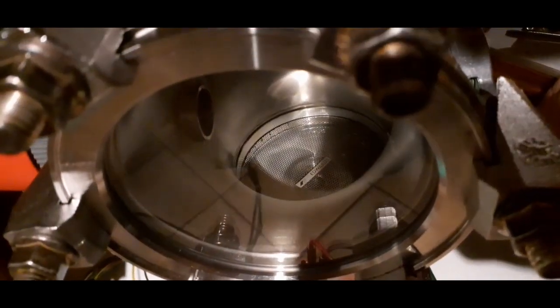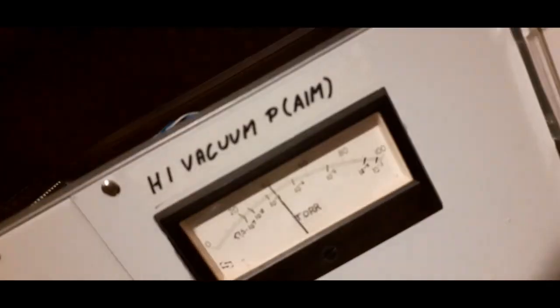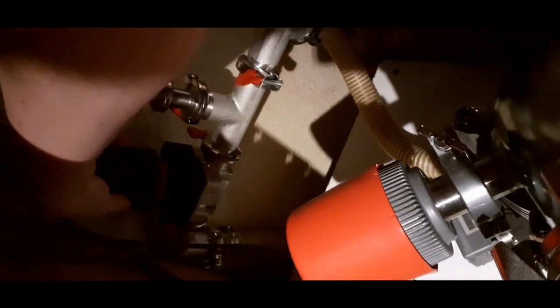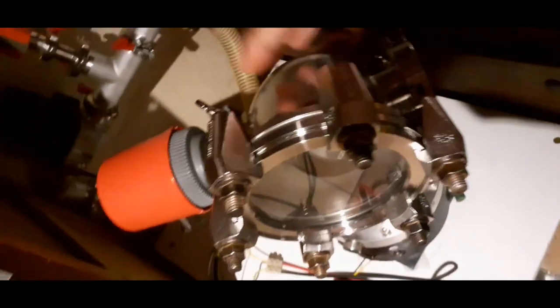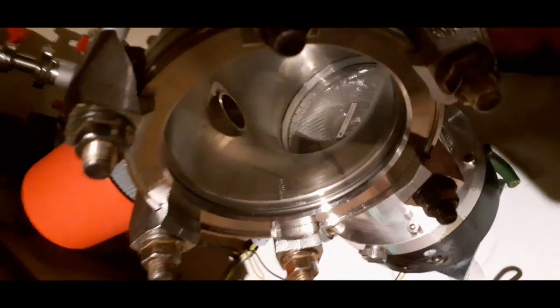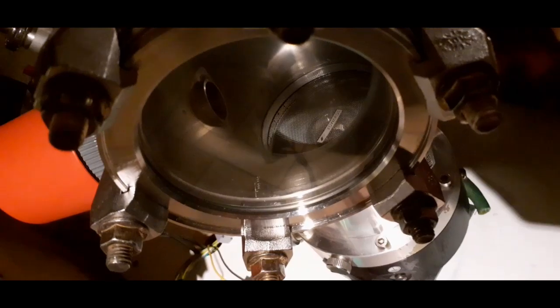Alright, let's go through the turning off procedure. I don't think we'll get the pressure any further down tonight. So, what you do is you separate the two pumps by this shutoff valve here. Right now the turbo is completely separate from the rest. You turn off the pump, light goes out, power falls to nothing, and the turbo will now spin down over something like 20 minutes. Let's come back when it's done that.